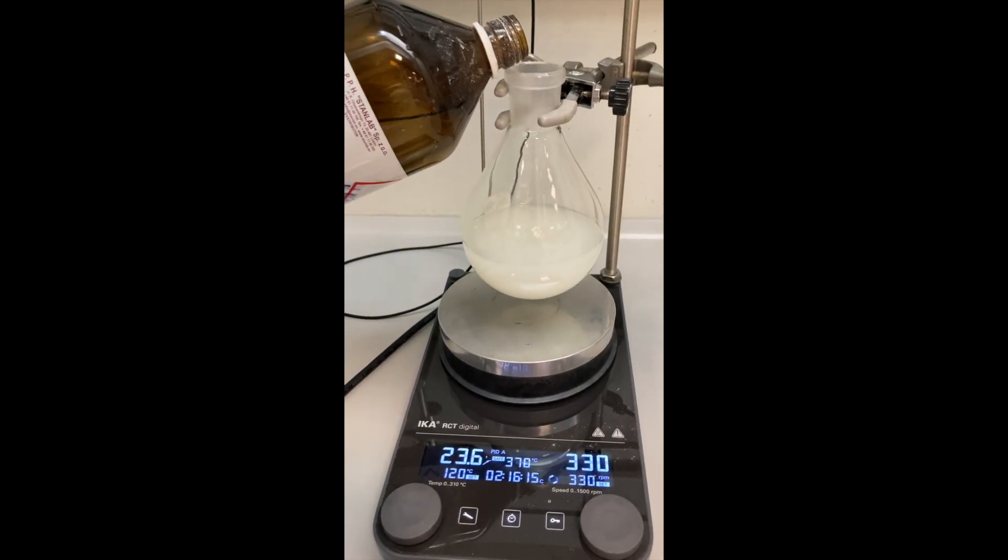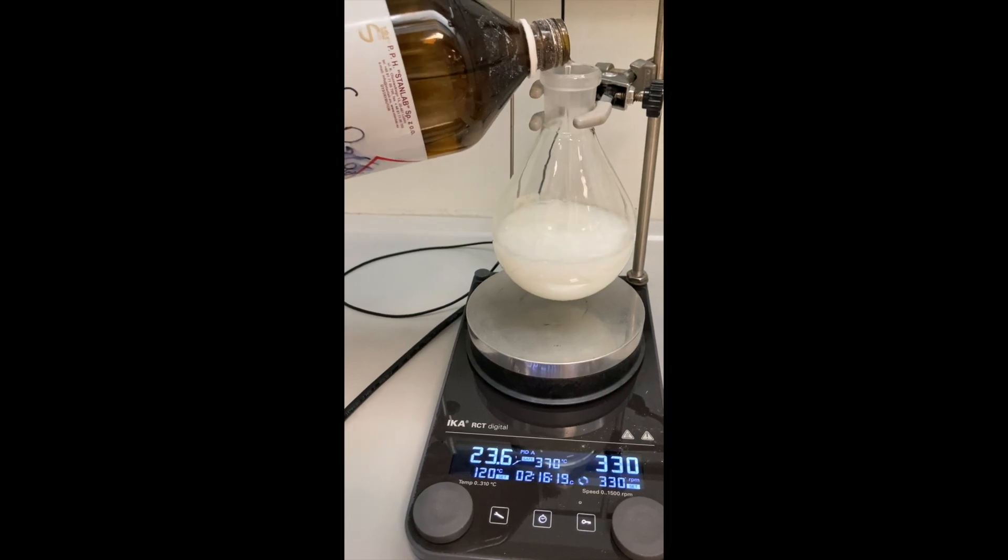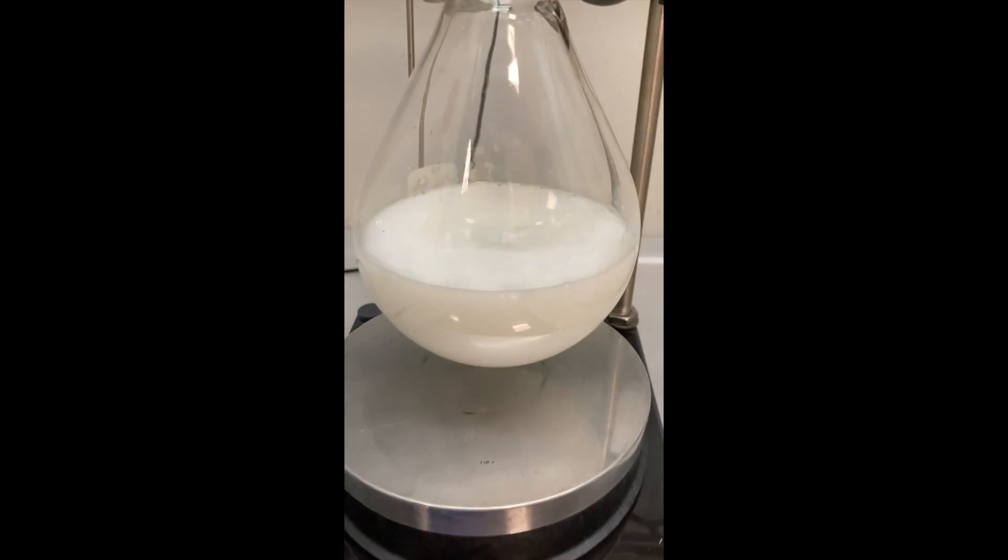Then, I quenched the reaction mixture with a saturated aqueous solution of sodium thiosulfate. Immediately after the addition of this solution, gas evolved.